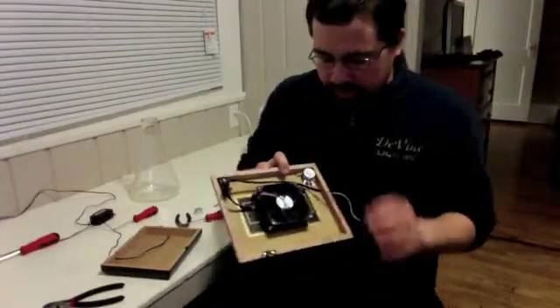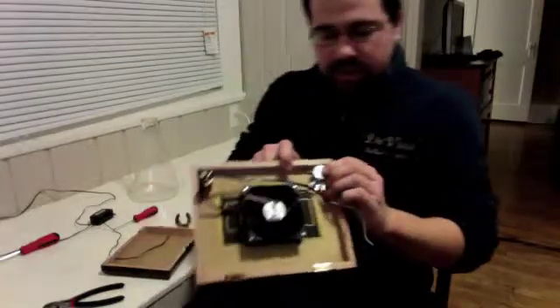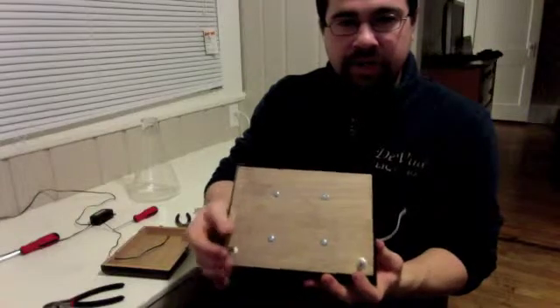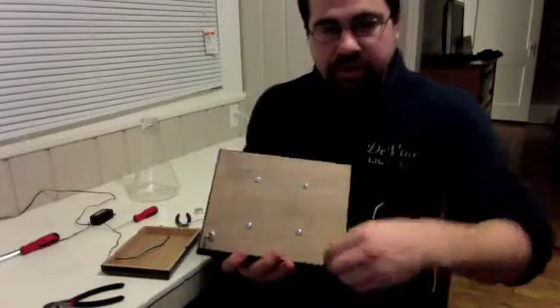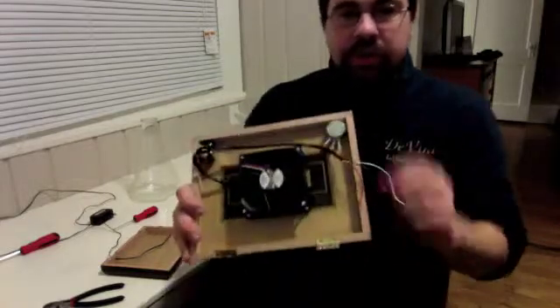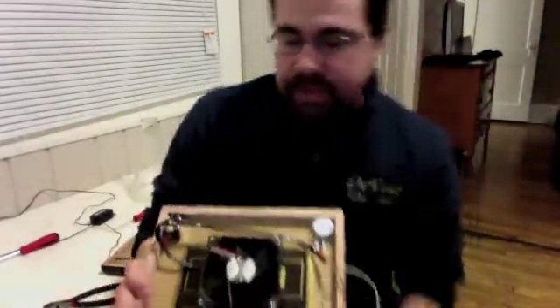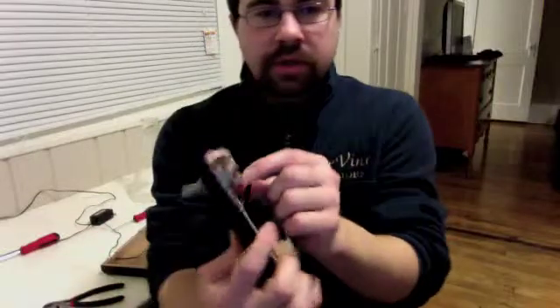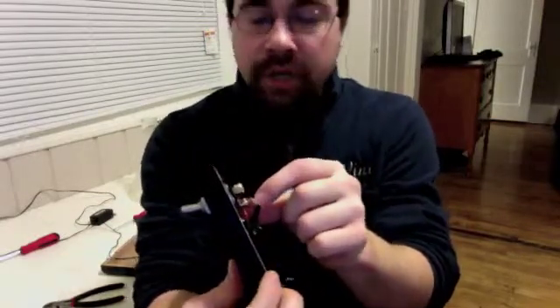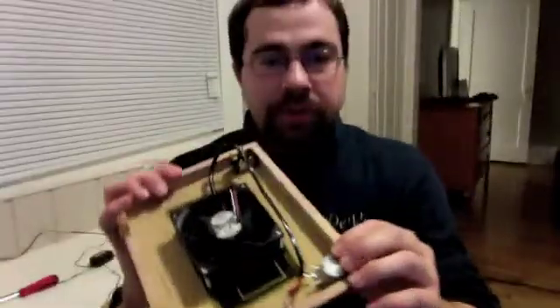So this is what we have right now. This is the rheostat. So I have it set up so that when we look at the top, we have the on and off switch here, and then the dial is going to go right up on top here. And this is what it looks like. So you're going to wire it up the same way you did the on-off switch over here.